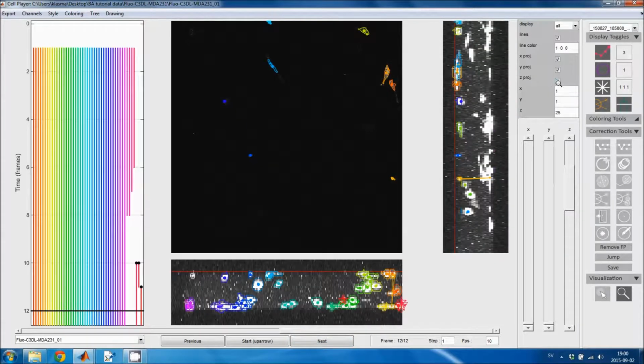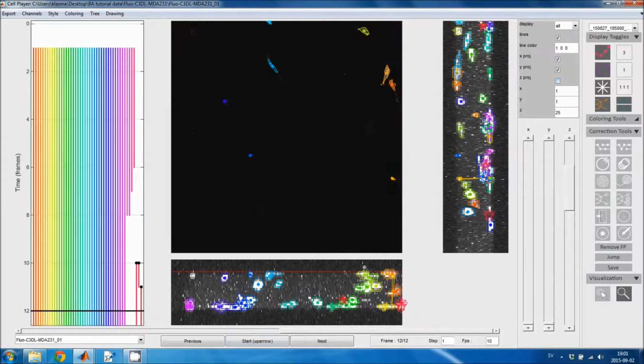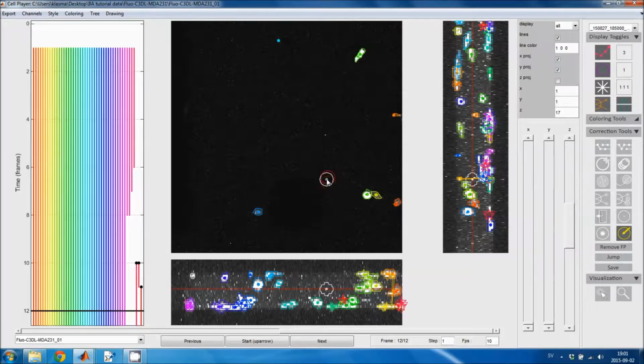Now I'm zooming out and I'm looking at the maximum intensity projection again. I can choose between having a disc-shaped brush and a ball-shaped brush. If I select the ball-shaped brush and I want to place a ball somewhere here, then I just select a brush size that I want, and then I can click to generate the ball. I can also drag to get a bigger region.